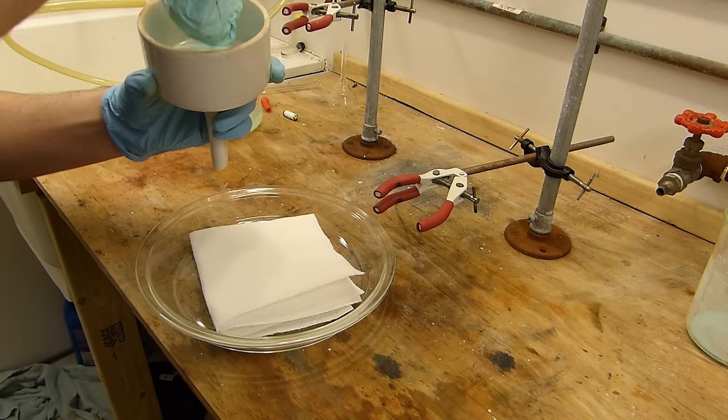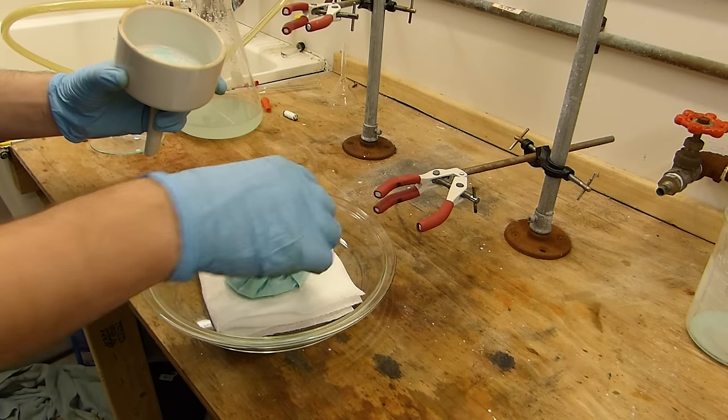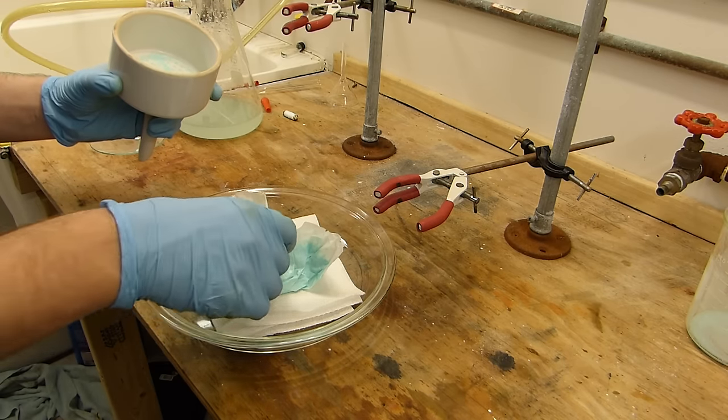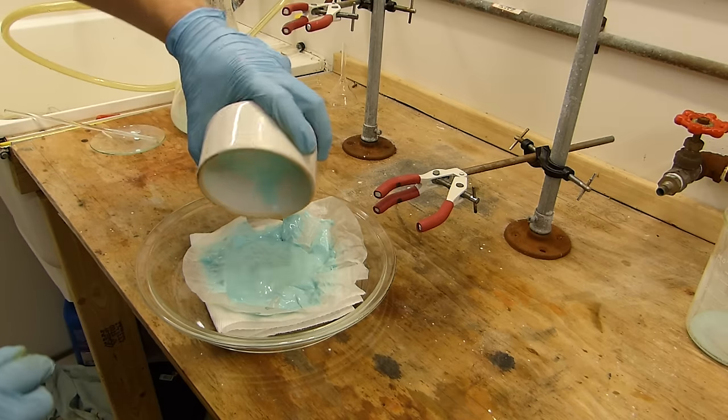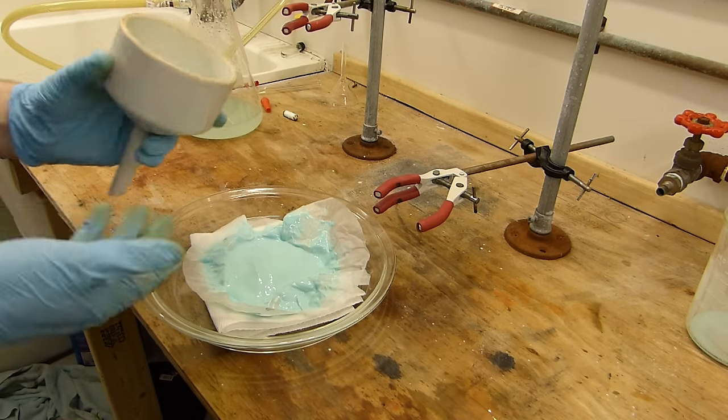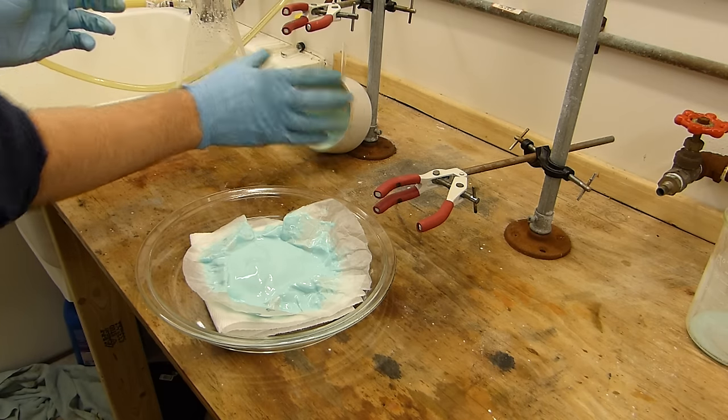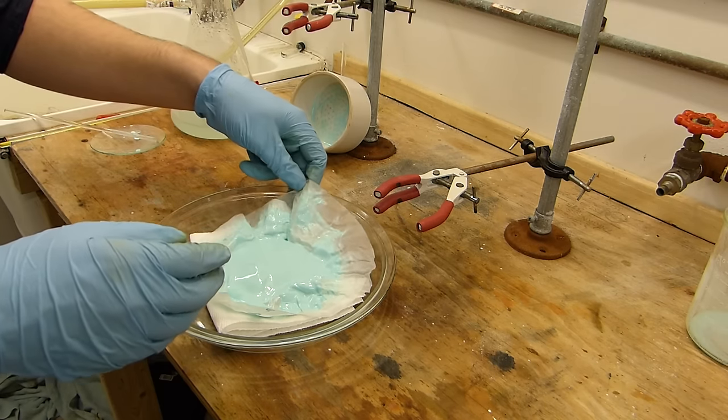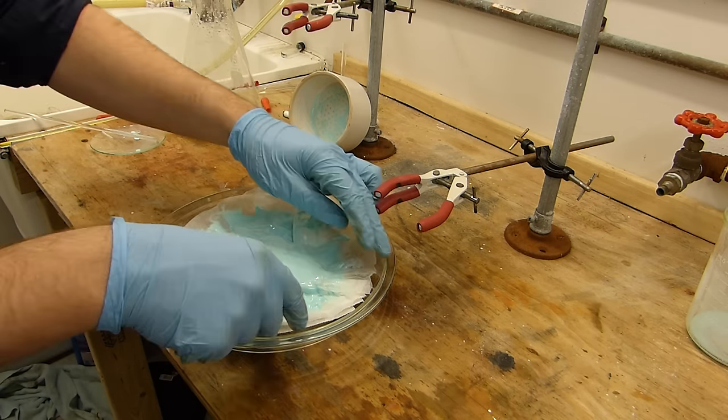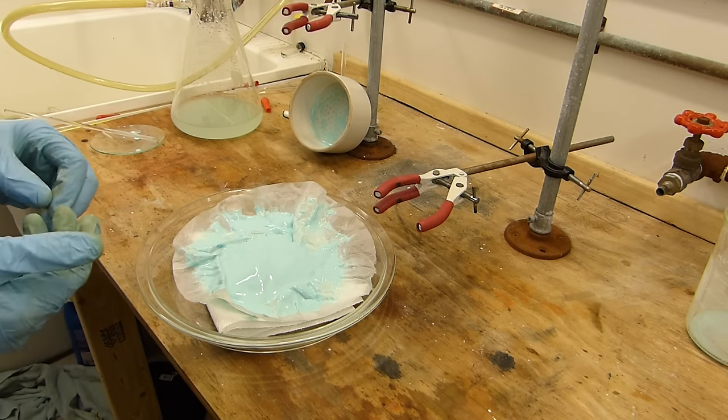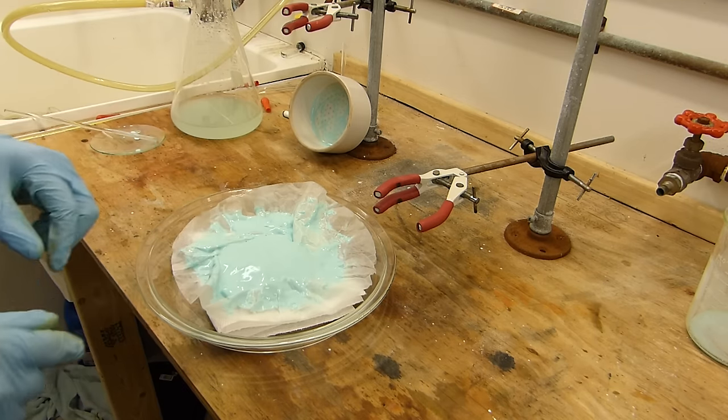Gather this wet mass up, drop it there. There's a bit left on here which I'll pour on top of this if I'm careful. Open this up and the paper towel will suck the majority of the water out of that paste. This is a particularly terrible vacuum filtration I have to admit. The particulate size is extremely fine and I was not very successful at maintaining a good vacuum. I'll have to change the paper towel a few times in the next couple of minutes because it's going to saturate through pretty quickly. You can see how fine the particulates are, it's going right through the coffee filter.